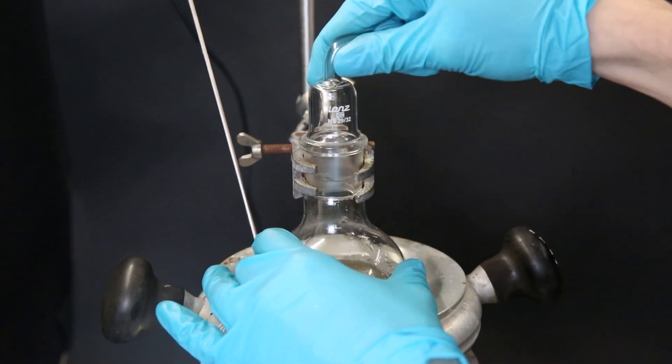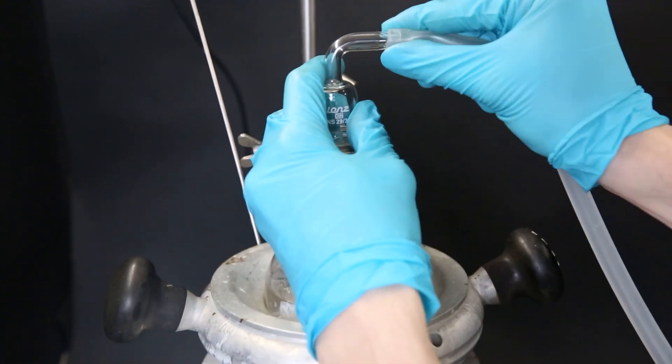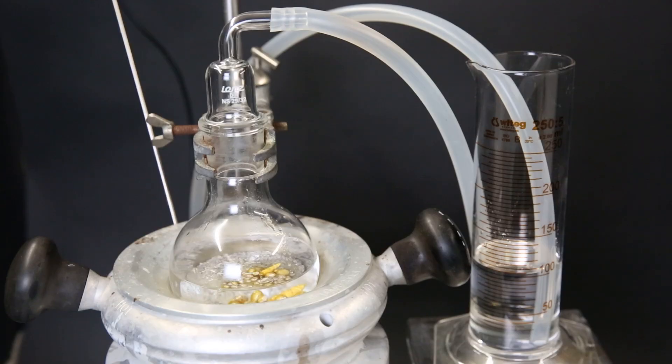I then add a gas adapter on top and attach a hose that leads into a bubble trap. This bubble trap is simply a graduating cylinder filled with some paraffin oil.